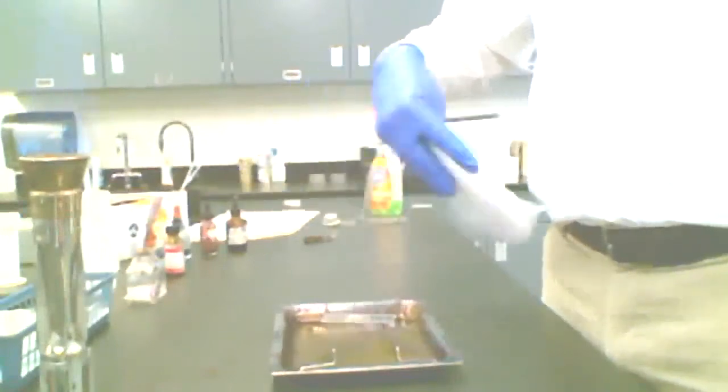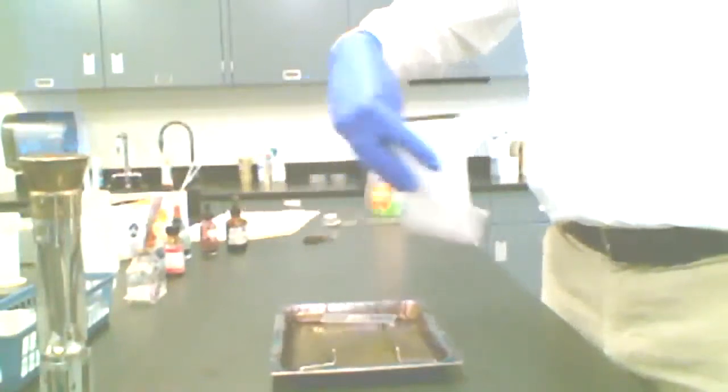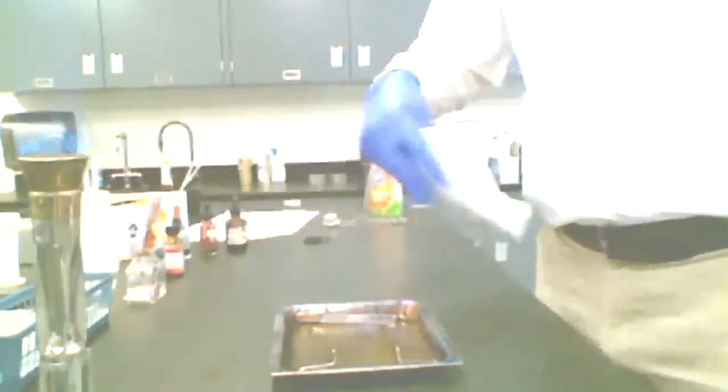The thing about that is that if we're not using aseptic technique with our specimens when we're subculturing them, then they will become contaminated, and then any test that we want to run with those organisms may give us false positives or false negatives, depending on the test that we're running.